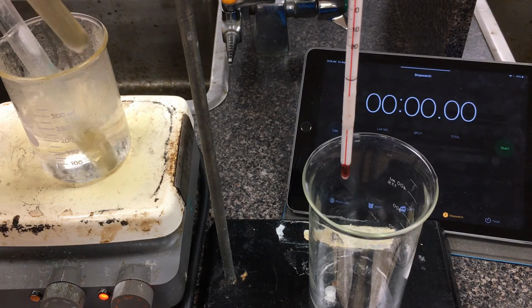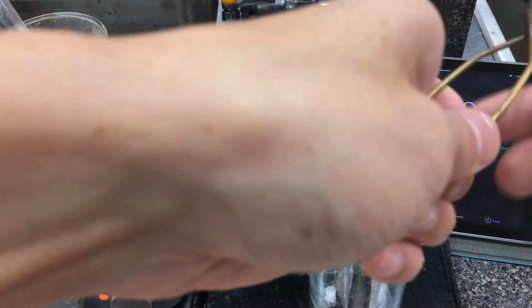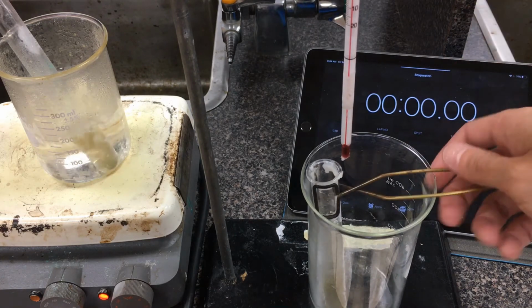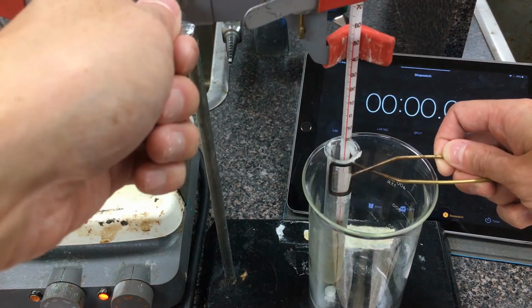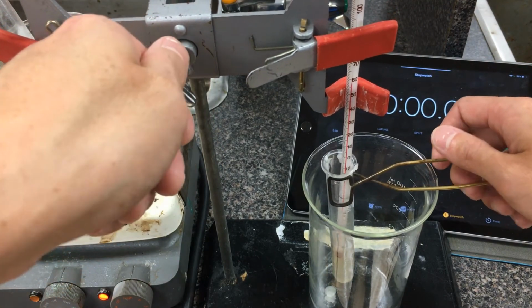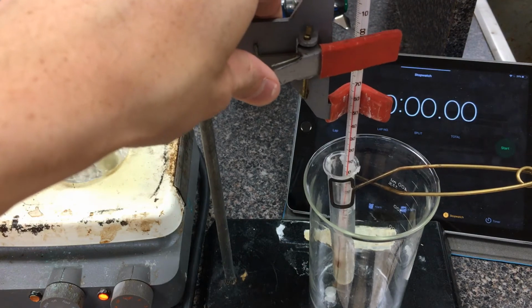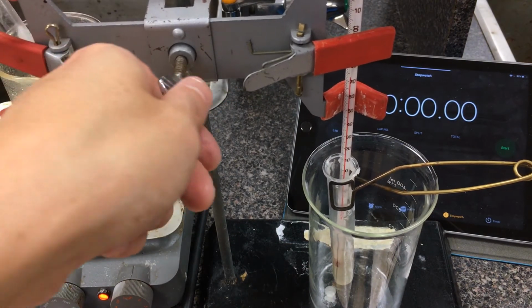Right now here it's a liquid. I'll give you a chance to see it beforehand. Okay, I'm going to just prop it into this stand here. Make sure it's standing up as much as I can there. I'm going to lower my burette stand so that my thermometer can sit nicely inside the stearic acid. We're going to give it a while for the thermometer to actually equilibrate to the temperature of the stearic acid before we start taking down some readings. Hopefully you can still see the stopwatch there.